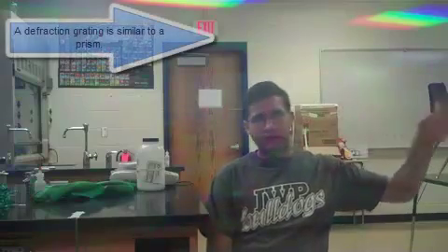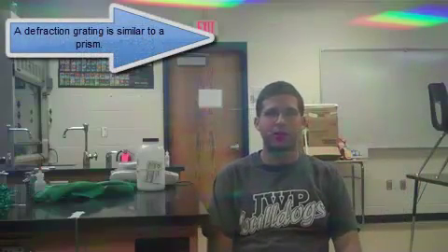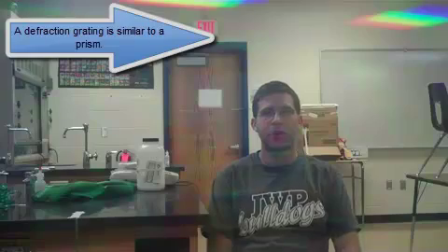If you notice, there's some weird colors. I put a diffraction grating over the camera lens to be able to make it so that not only can you see the color of the flame, but hopefully you'll be able to get an idea of what the spectrum it breaks into.